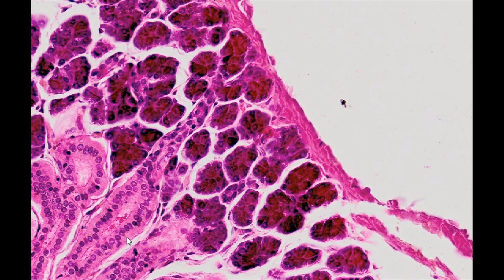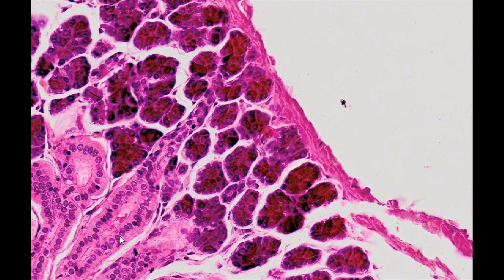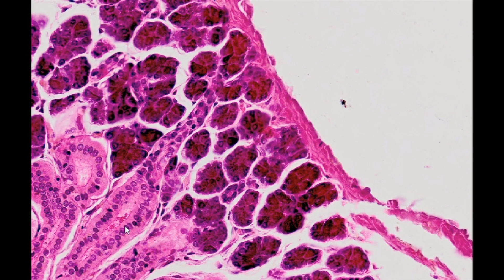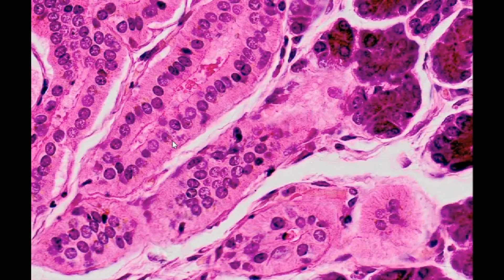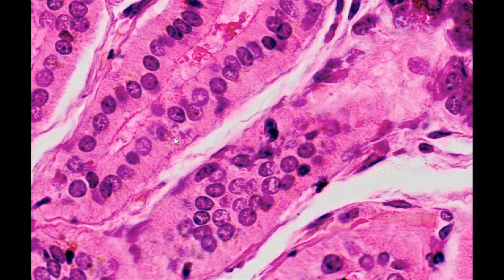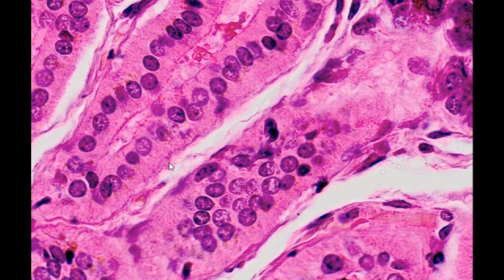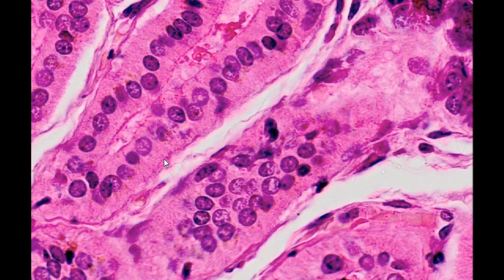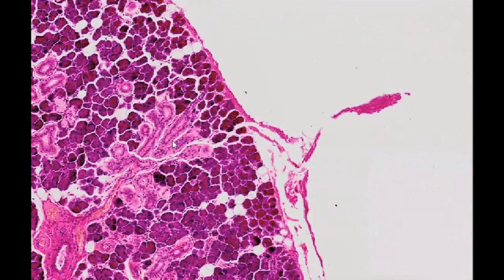The striated Pfluger's duct, which is long in the submandibular gland and has only a single layer of columnar cells, is another segment of the ducts. The striation in the basal part of the cells is the result of multiple invaginations of the cell membrane and the accompanying columns composed of mitochondria.